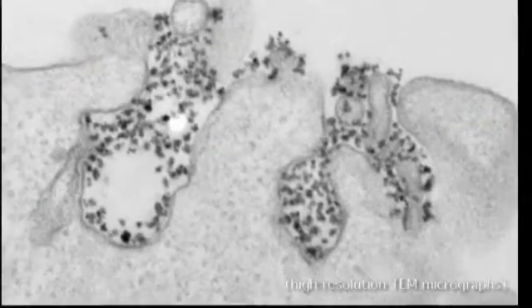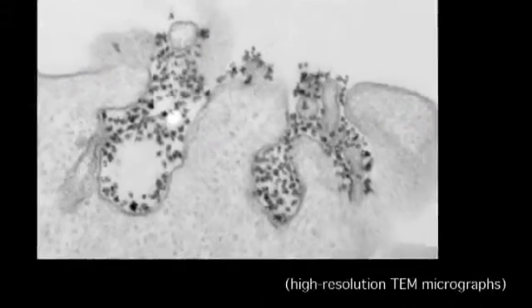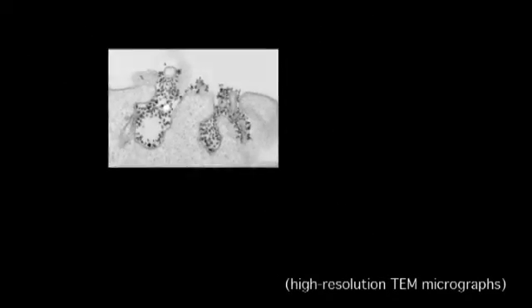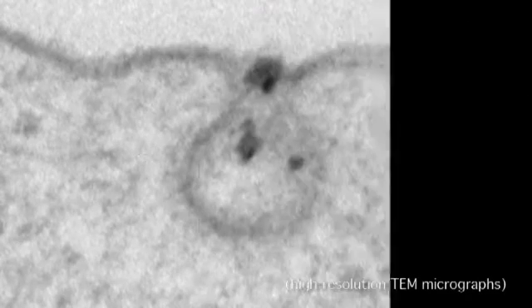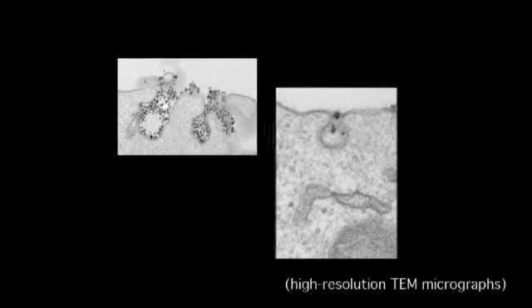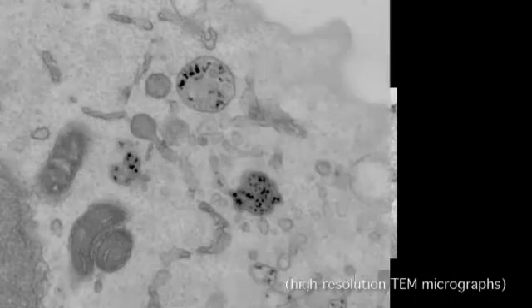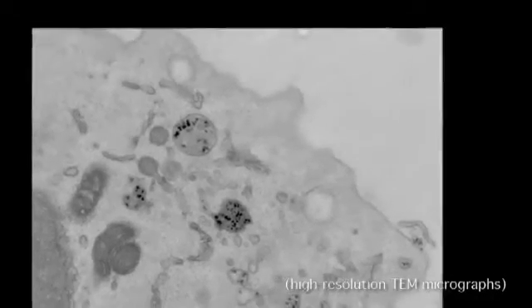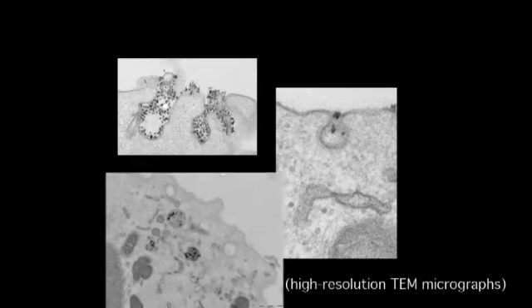In this image, we see the Miltenyi microbeads on the plasma membrane. Here, the Miltenyi microbeads are being internalized via a clathrin-coated pit. And here, the Miltenyi microbeads are accumulating in endocytic compartments.